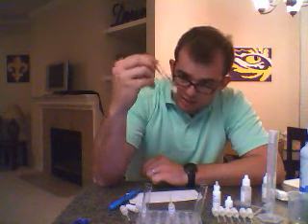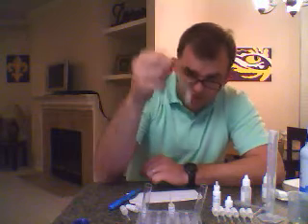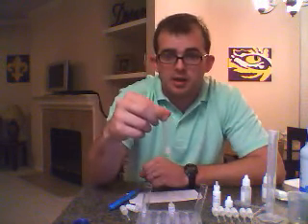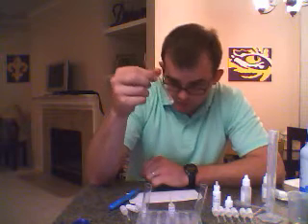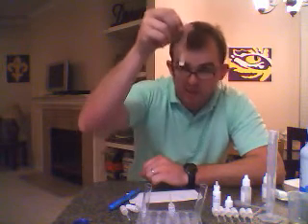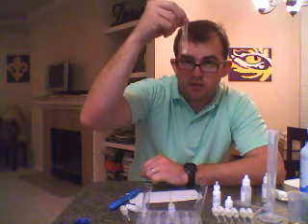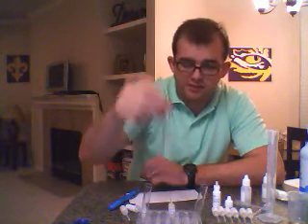And I really don't see much of any change. It may have added a little bit of precipitate in it, so the precipitate does not dissolve. It almost like it helps it solidify a little bit.